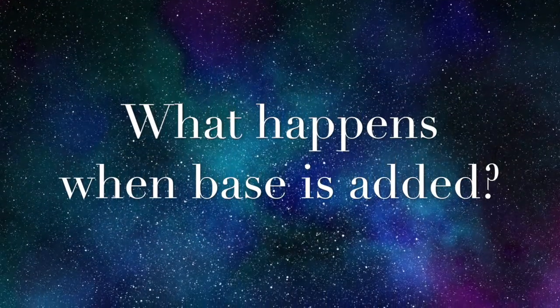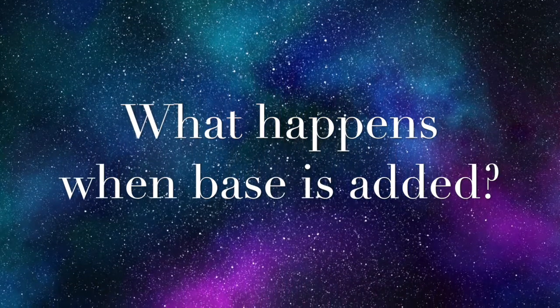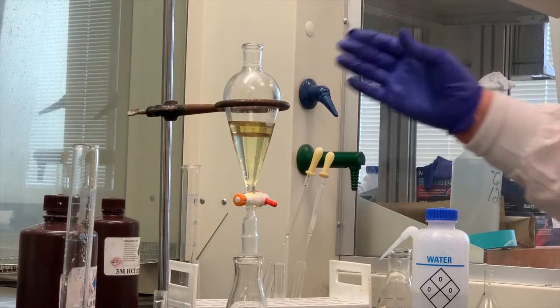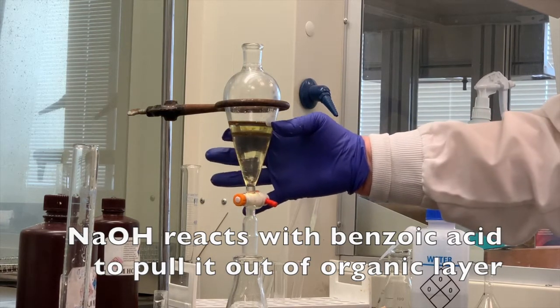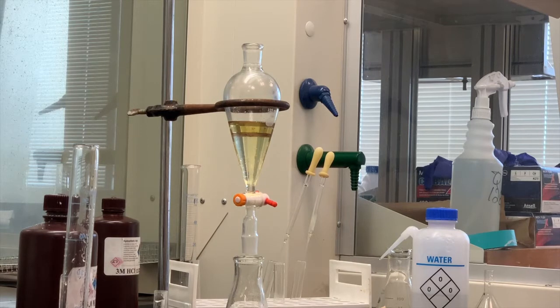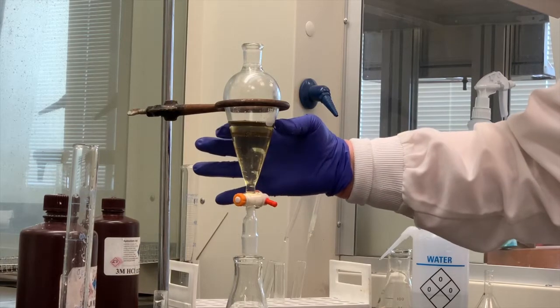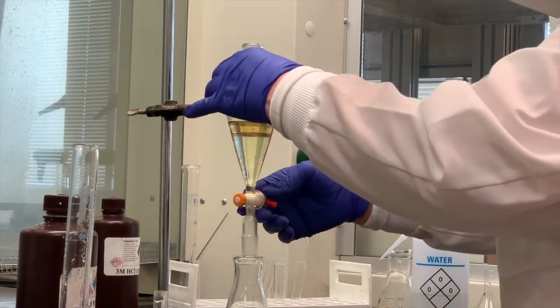So let's talk about what we did in terms of adding the base. We've assumed that we've already removed the p-nitroaniline because it went into the acid layer. So the only things we would have had in the organic layer would have been the naphthalene, which is neutral, and the benzoic acid. So if we add base to that mixture and we get two different layers, what that means is that the sodium hydroxide reacted with the benzoic acid. It pulled it out of that organic layer. So the benzoic acid now is the benzoate salt, or the salt of benzoic acid, just as if you mixed hydrochloric acid with sodium hydroxide, you get a salt, sodium chloride. We're also getting a salt, both of which would be soluble in water. So our salt of the benzoic acid should be in the top layer, which is the aqueous. The only thing, hopefully, that's in the organic layer is our neutral compound, which would be naphthalene. So we're going to collect the neutral.